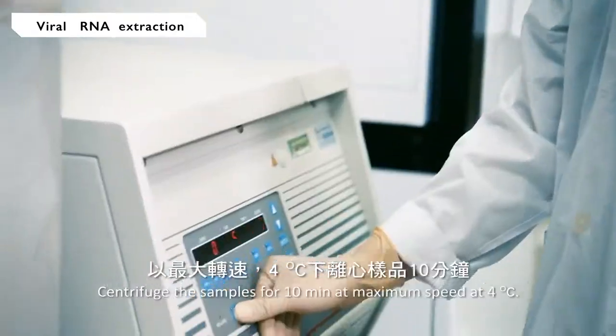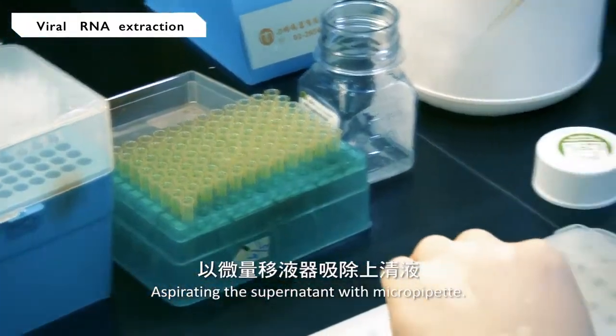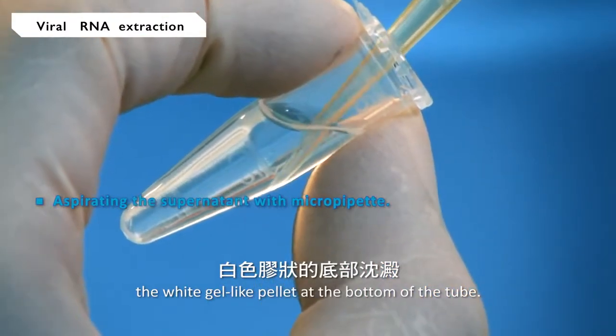Centrifuge the samples for 10 minutes at maximum speed at 4 degrees Celsius. Aspirate the supernatant with a micropipette, and avoid contacting the white gel-like pellet at the bottom of the tube.